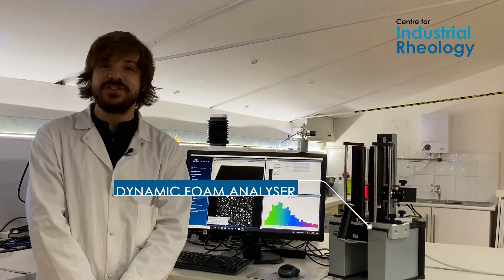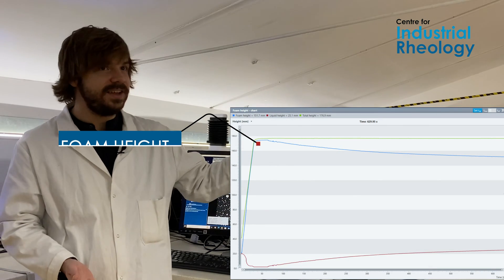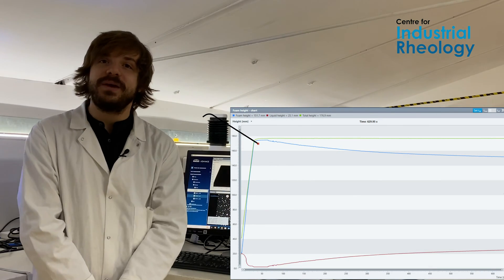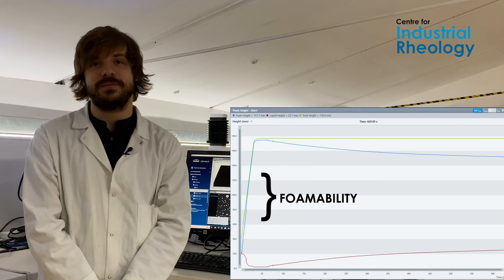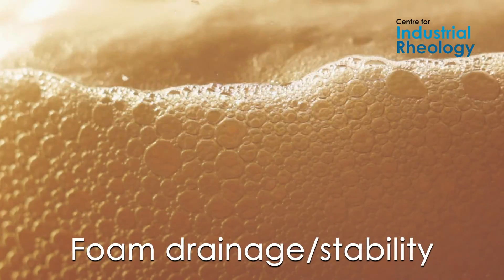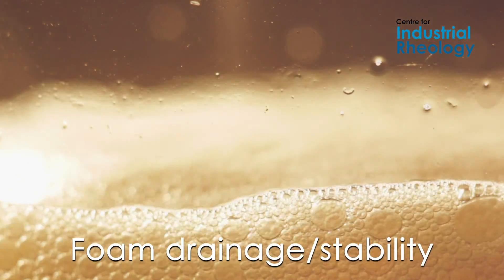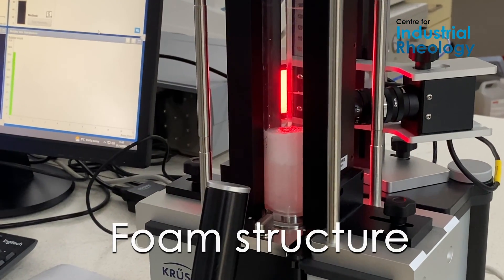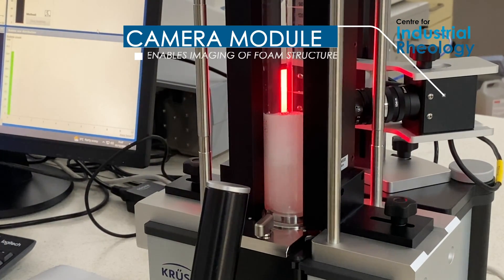It offers a multitude of insights into foam behaviour by studying its foam height. It can measure its foam ability, which is the propensity of a substance to foam, and also the foam stability — once that substance has foamed, how quickly it drains and how much the height decays. It also studies its foam structure with this nifty little camera module we've got on it.